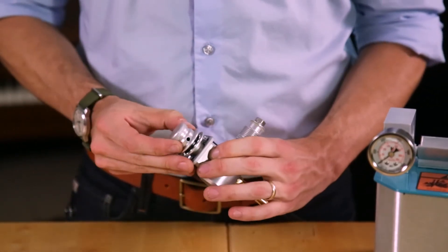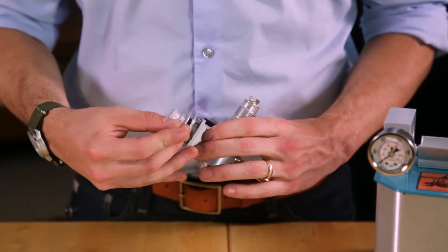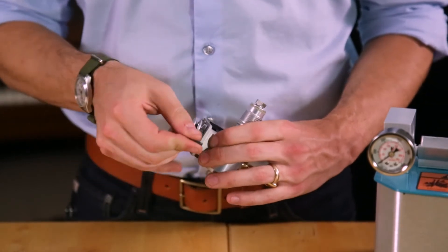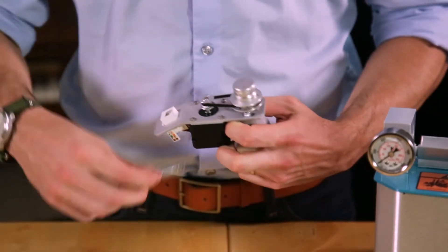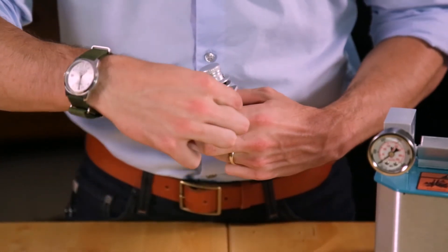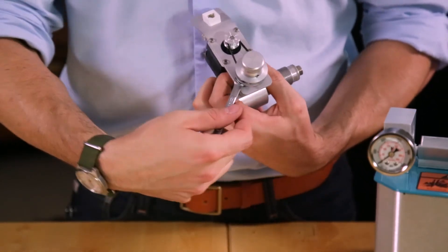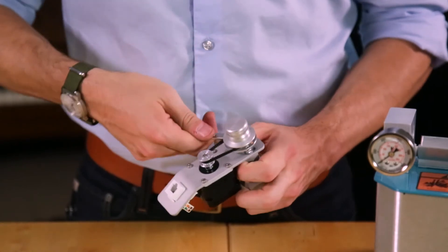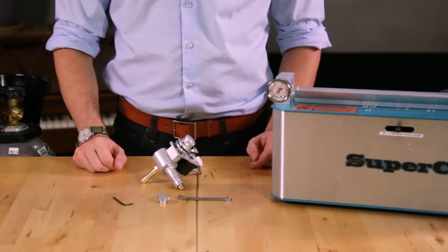You want to be sure that this set screw lines up with the flat on the brass pin. Once they're aligned, you can tighten it, tension the belt, and secure the mounting bolts the rest of the way. And that is the assembled stepper motor and vent valve.